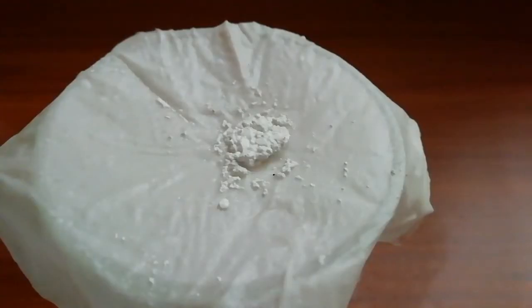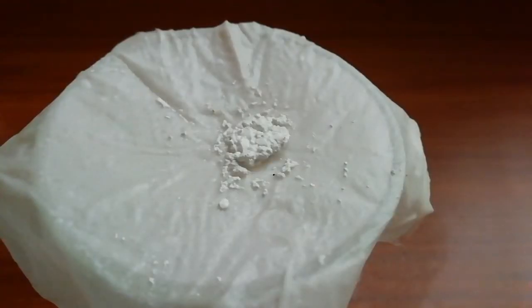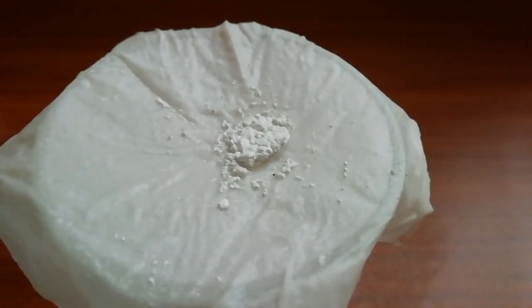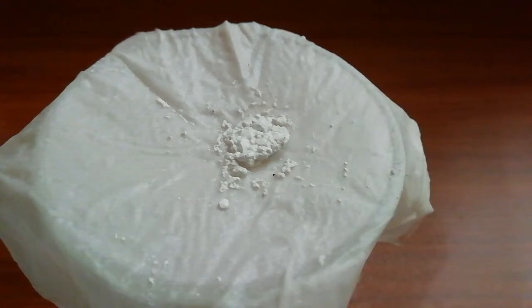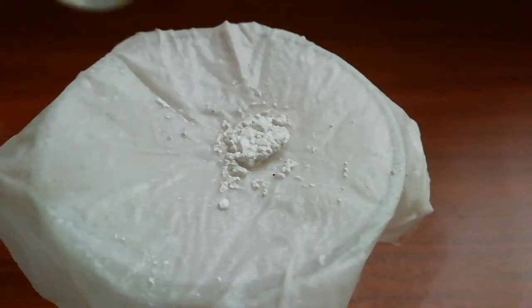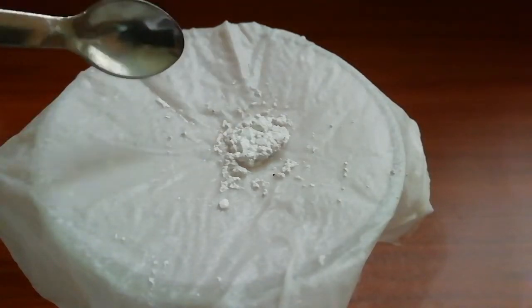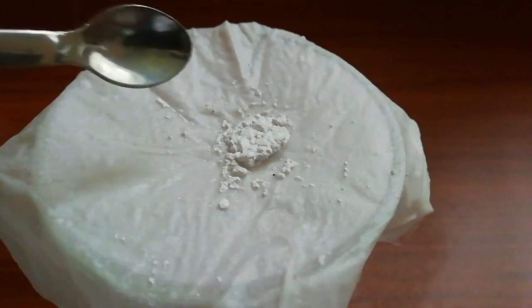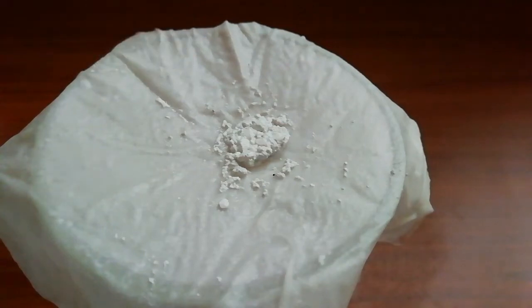Now you can see the silver chloride here. I'm going to transfer this silver chloride onto a piece of glass.